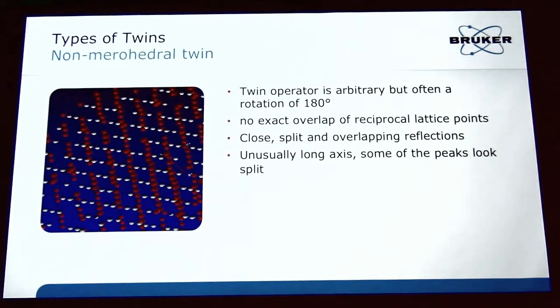And then finally, there's something called non-merohedral twin, which probably a lot of you have seen, but really haven't dealt with. Everyone has crystals that maybe don't grow single, or in some cases you can call them cracked crystals, non-merohedral twins, but we get kind of strange between calling what's just multiple crystals and what's a really true twin. But in this case, the twin law between the domains is arbitrary. So the crystals can be oriented in sort of any way, but a lot of times it's similar to other twinning where it's 180 degrees between the domains. You can tell in this case where it almost looks like you do have intersecting lattices.